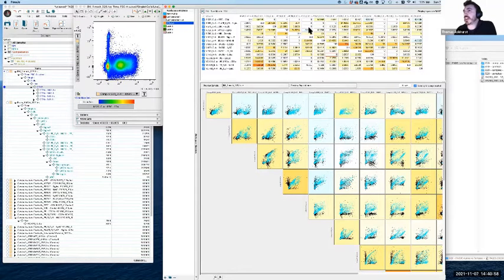One thing which people might actually have spotted already is there's a couple of spots here which have negative values. I was saying that this is a correct matrix, and I actually take that back. The fact that there are negatives here suggests that I have messed something up along the way. This is an old data set I went back to, so potentially this wasn't perfect, but you shouldn't have negative compensation values. Sometimes, with the mathematical error that can occur, you can get very small negative numbers that are very near zero. So they're probably just minor errors. If you're getting negative whole numbers, negative 2, 3, 4, 10, whatever, then something has gone wrong.